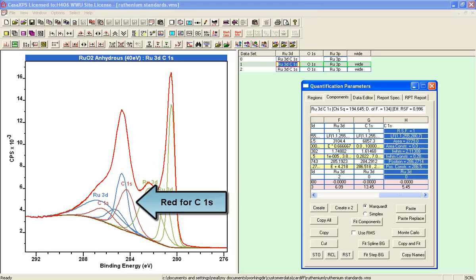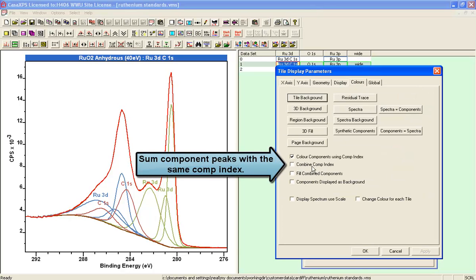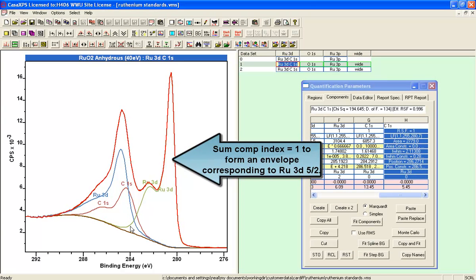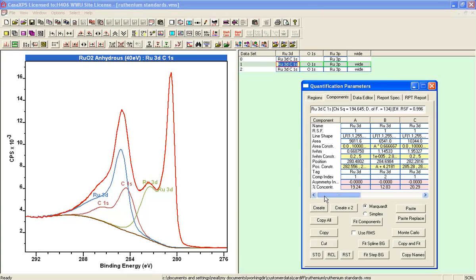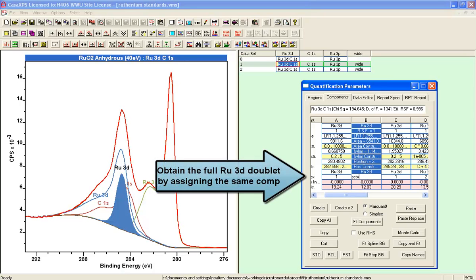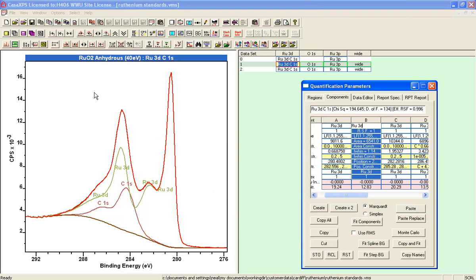These are the ruthenium 5/2 peaks, and another display option makes this clear what we're doing by saying combine component index. So when I tick this button and press OK, you can see how the components have all been summed to form envelopes that represent the 5/2, the 3/2 and the carbon 1s. Now what we're interested in is a line shape that corresponds to the full ruthenium 3D doublet. So what we'll do next is we'll set all the 3/2 peaks back to a value of 1, so they have the same component index as the 5/2. So we've now got a total envelope that represents the shape that we think we're going to get from ruthenium 3D doublet from this 4+ state.